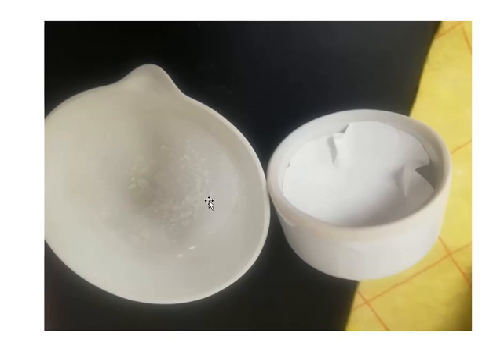Initially, before heating and passing the liquid through the filter paper, I will weigh this container with the filter paper before using it, and the weight of this dish separately. Once I get the weight of these two things, after filtration and heating, I can find out the total weight and subtract from that weight.